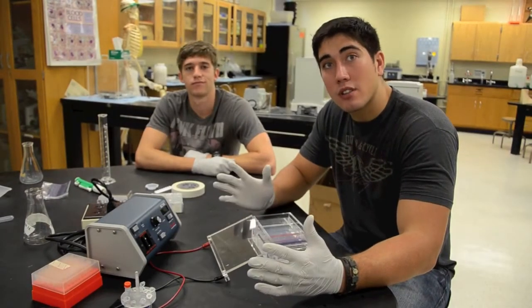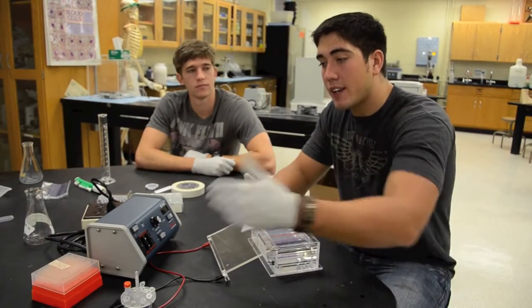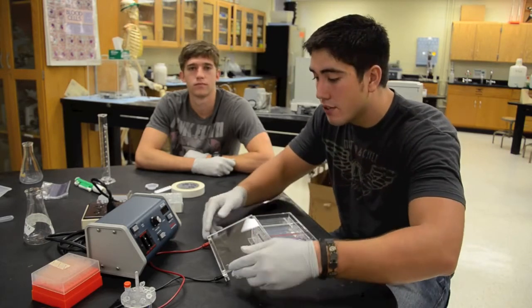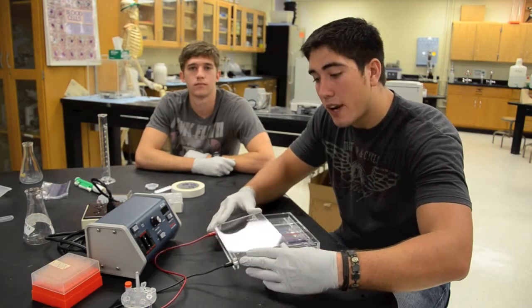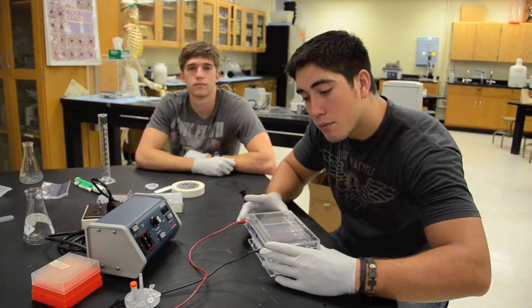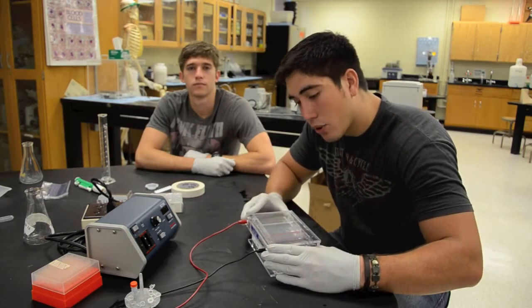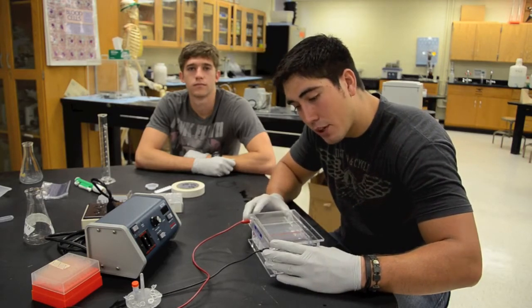Okay now we have our samples loaded, the only thing left to do is actually put the lid on and connect it to our power source. So the lid goes on similar to the way that it came off. Put in the actual current, the negative side and the positive side making sure they correlate with one another once again, put it on.